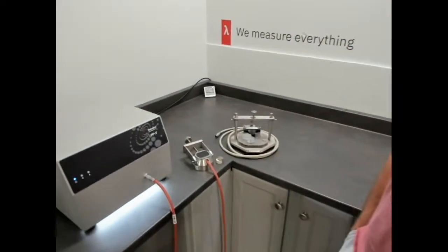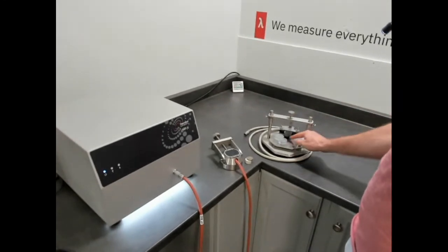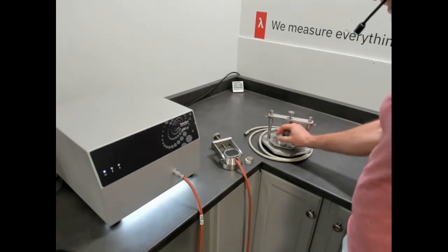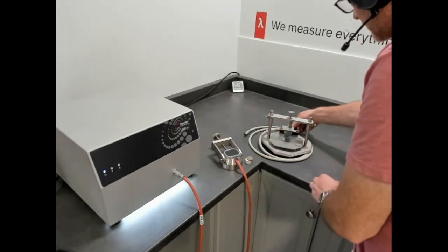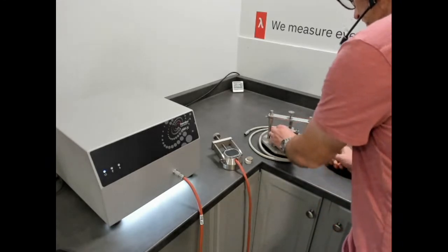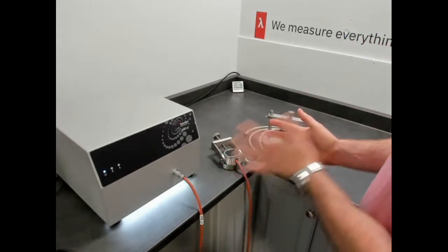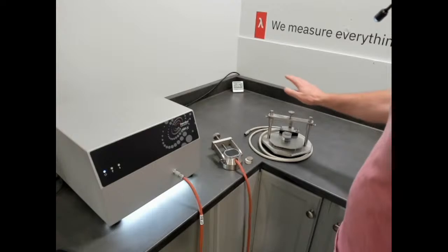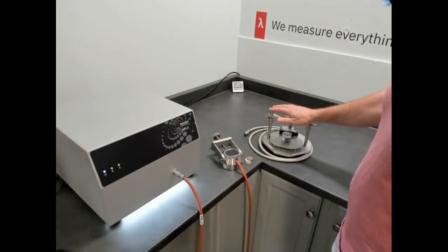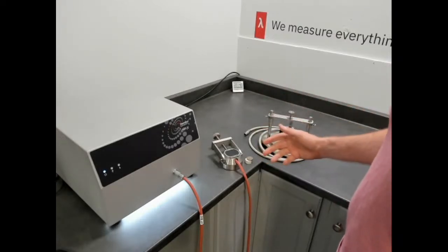So we're going to come over here. The MPV has a very similar room temperature sample holder. So you would set your sensor up in a very similar way. And if we were measuring these Lexans, we could do that symmetrically by lowering the sample, the sensor rather, and affixing the sensor in this configuration. And if that was connected to the MPV, we would make measurements in a very similar way to the MP1. So inside this sample holder, for measuring polymers and composites, you can measure bulk properties, and you can measure anisotropic properties.